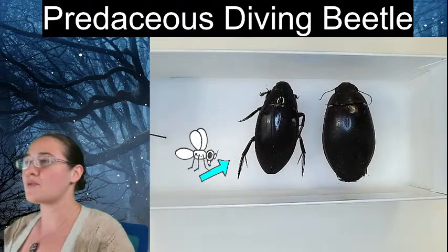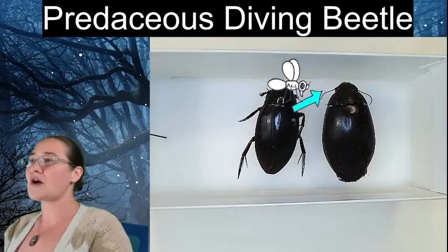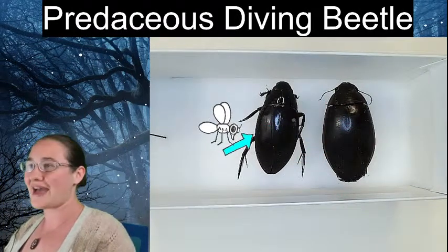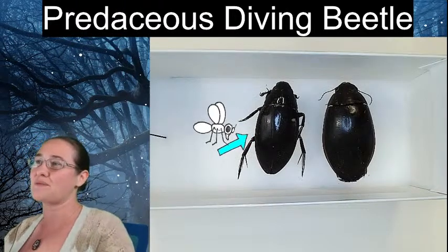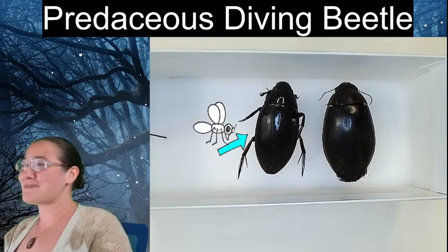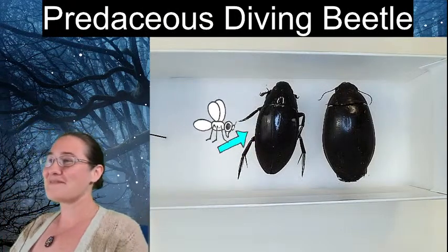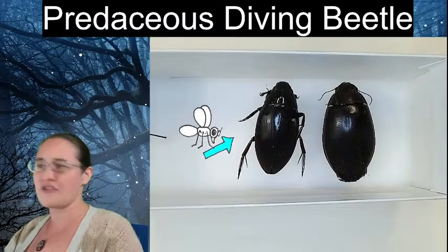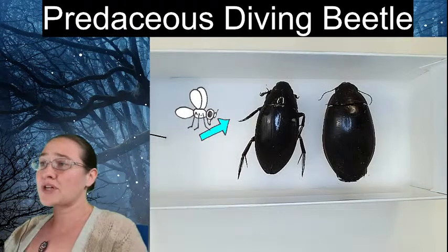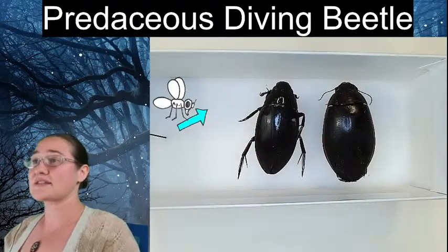The one I want to focus on today is the predacious diving beetle. After we look at its characters and sketch it, we can look at the scavenger beetle and compare those features. When you look at them overall they almost look like the same beetle — both large, both black, both swimming in the water — but we'll notice they have significantly different characteristics.